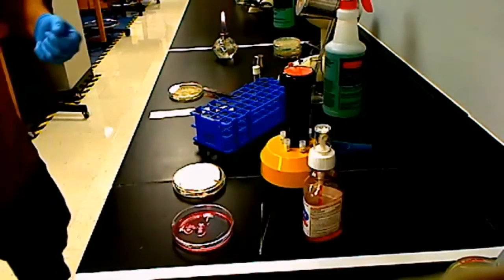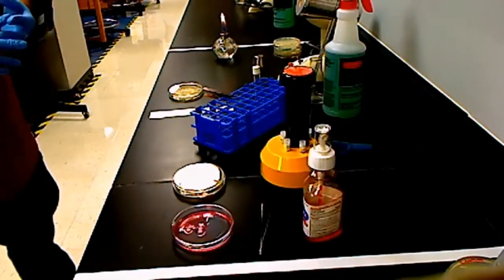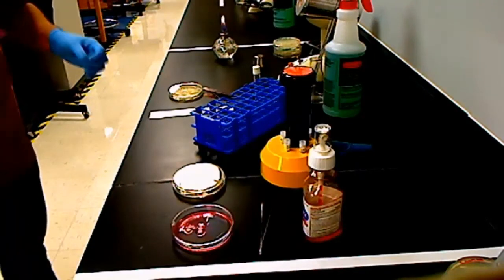Now, you're going to be working in groups in this lab, and you're going to have 6 plates to begin with. You have to label those plates with your group symbol. You're also going to label what's going to be on the plate. So you'll have 3 microbes on each set: 1 plate of Staphylococcus aureus, 1 plate of Pseudomonas, and 1 plate of E. coli. And as I said, you're going to have duplicate sets of that. So you have 2 sets, 1 for each experiment.